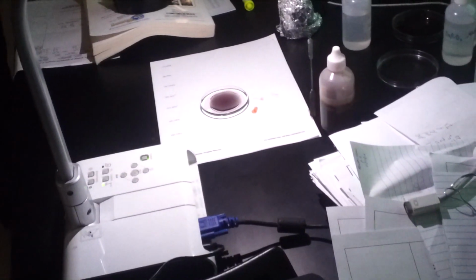I mean, you can do this with all sorts of other ions. Instead of the indicator, the best one to use is actually cerium ions. The other one didn't start up? Yeah, it didn't start up. I couldn't tell why. It just doesn't happen sometimes. But actually, no, I think it is going now. Just slower, probably. Yeah, I'll move that one in there. This one's going, and it's a little bit bigger, so it should be a little bit easier to see. Let's see if I can get this to go, the silver a little bit. Oh, look at it spread.